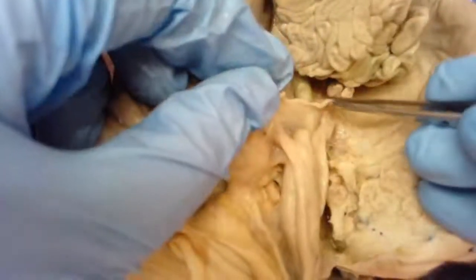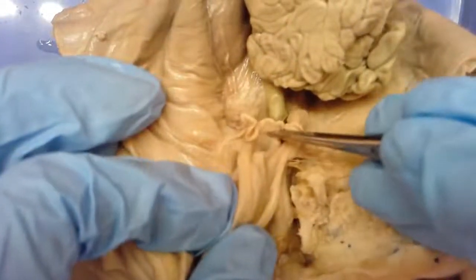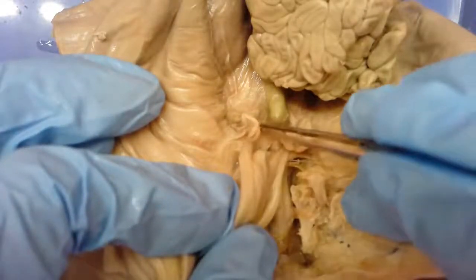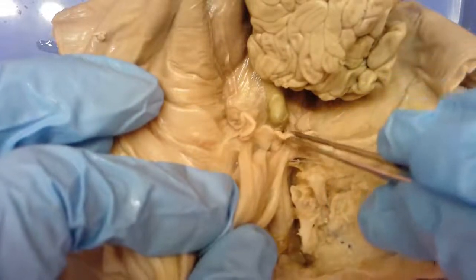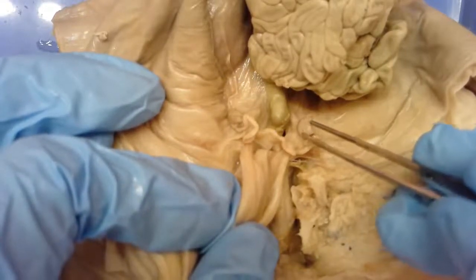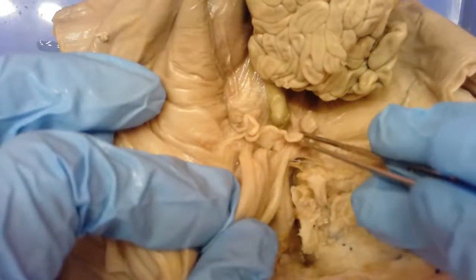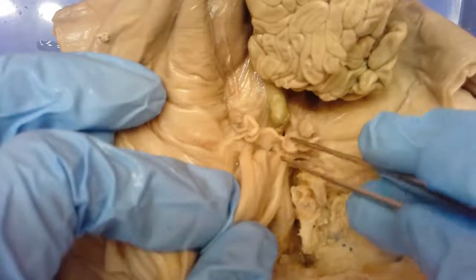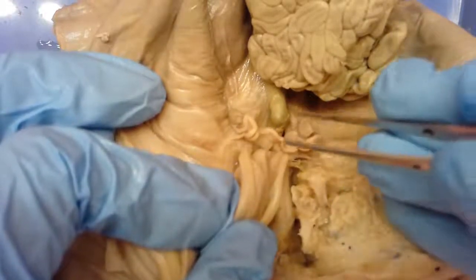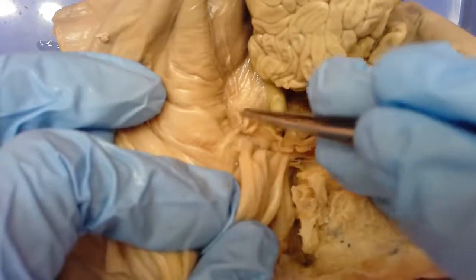Following the ovaries you see these little branches that form a Y-shaped structure, and they kind of meet in the middle at this central structure - where I'm grabbing - which is the uterus. These branches coming from the uterus are the horns of the uterus. These structures are unique in animals that can have multiple births, like dogs, cats, and pigs. These horns of the uterus can hold multiple piglets developing inside.